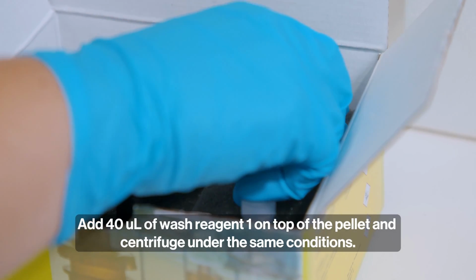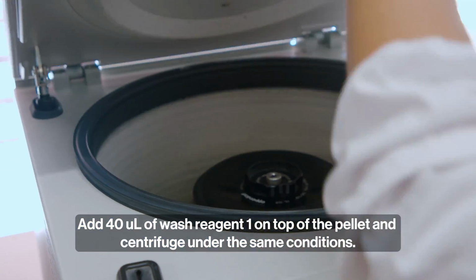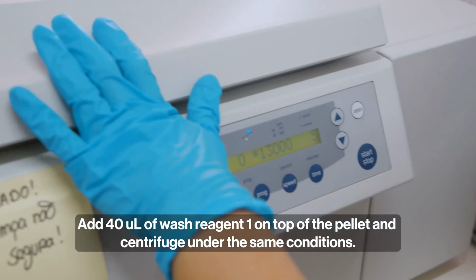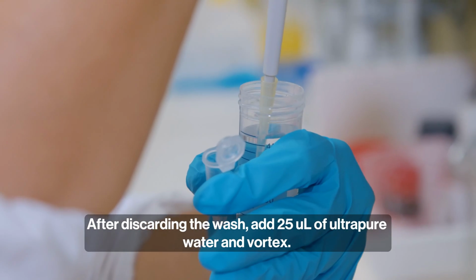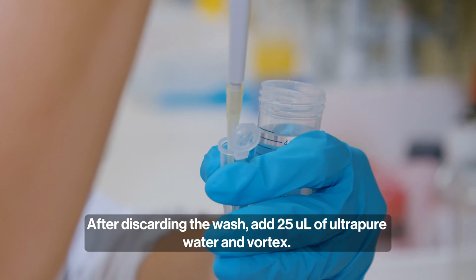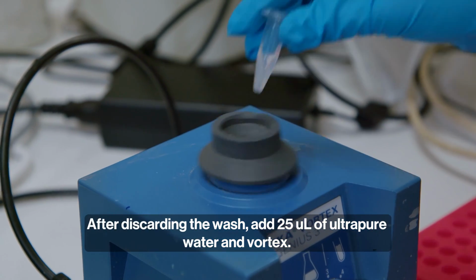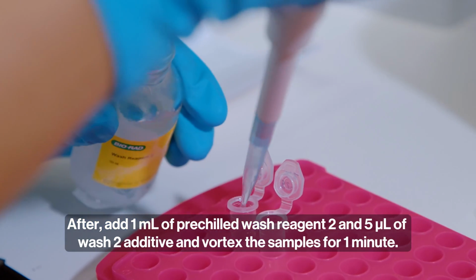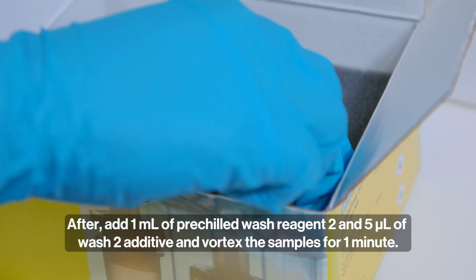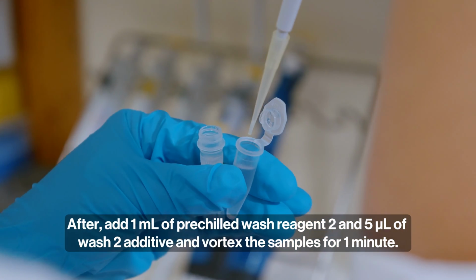Add 40 microliters of wash reagent 1 on top of the pellet and centrifuge under the same conditions. After discarding the wash, add 25 microliters of ultra-pure water and vortex. After, add 1 ml of pre-chilled wash reagent 2 and 5 microliters of wash 2 additive and vortex the samples for 1 minute.